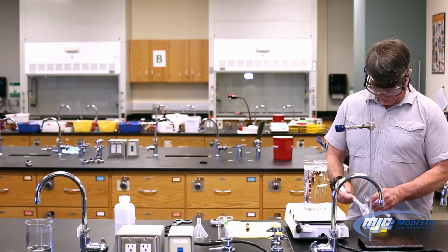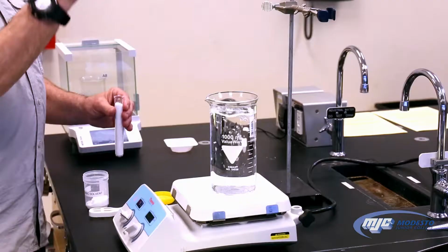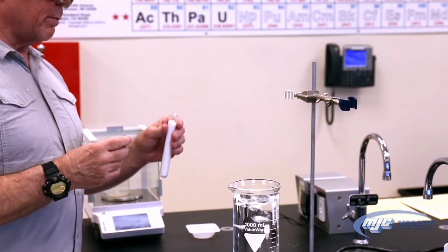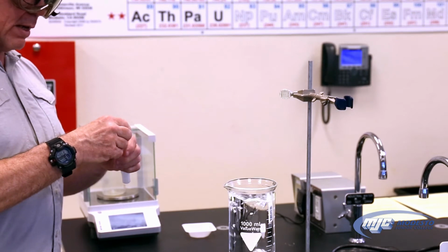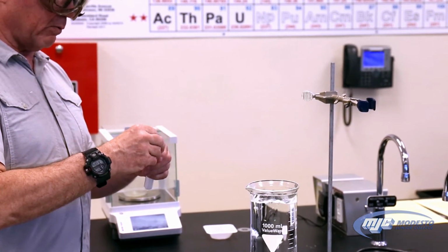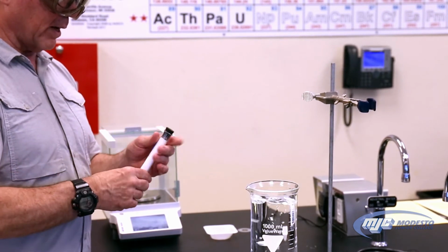So now what I'm going to do is take my rubber stopper. It's a one-hole rubber stopper. And we always do this with rubber stoppers before we put them in glassware. There's a wide end and a narrow end. We take the wide end and make sure it does not fit in the hole, because if it does, when we turn it around this way and put it the way it's supposed to go, it'll go all the way in and then you get stuck and you have to break the glass to get it out.